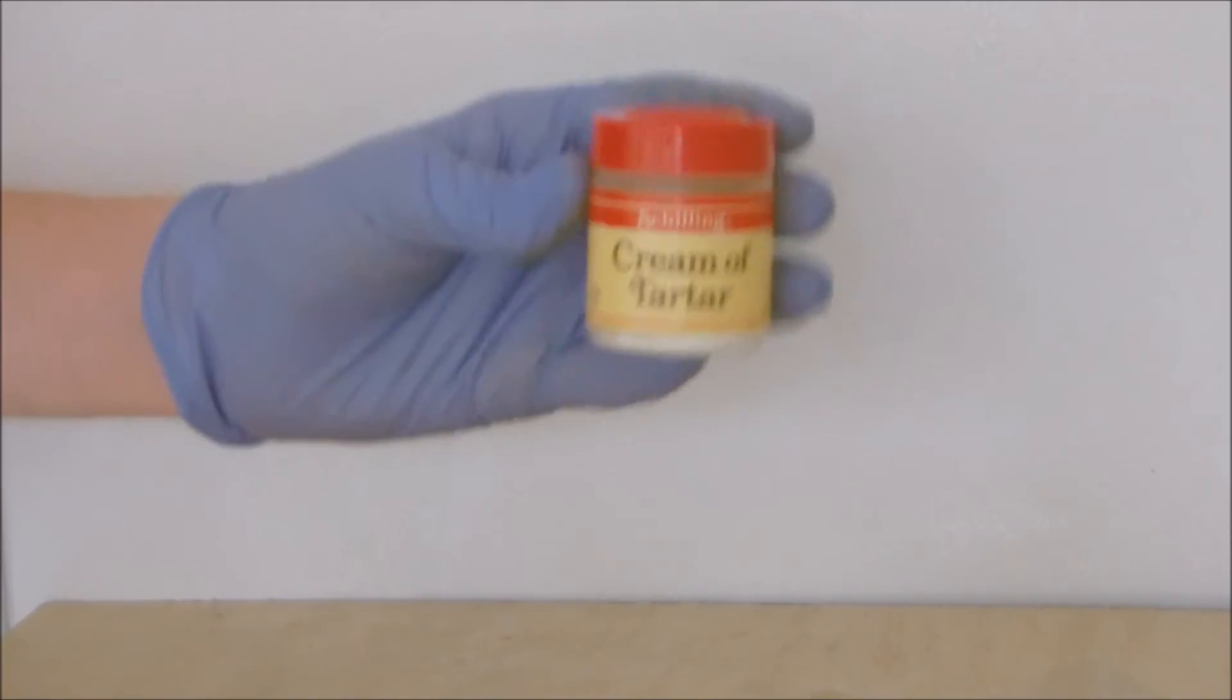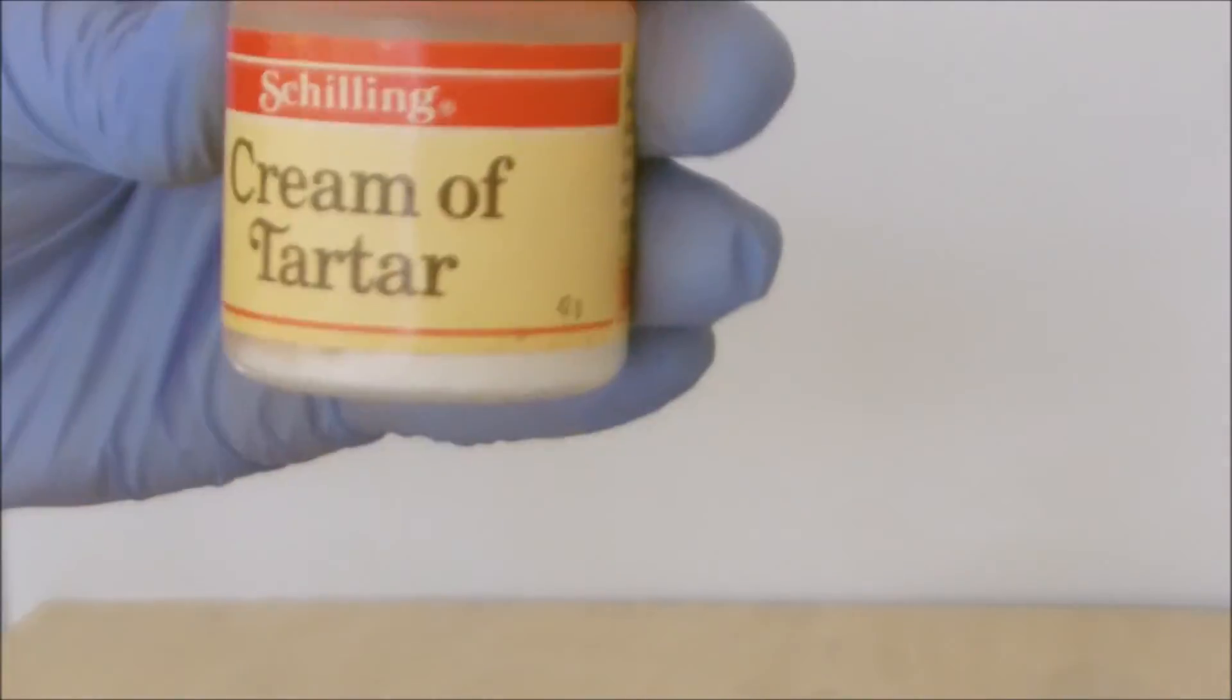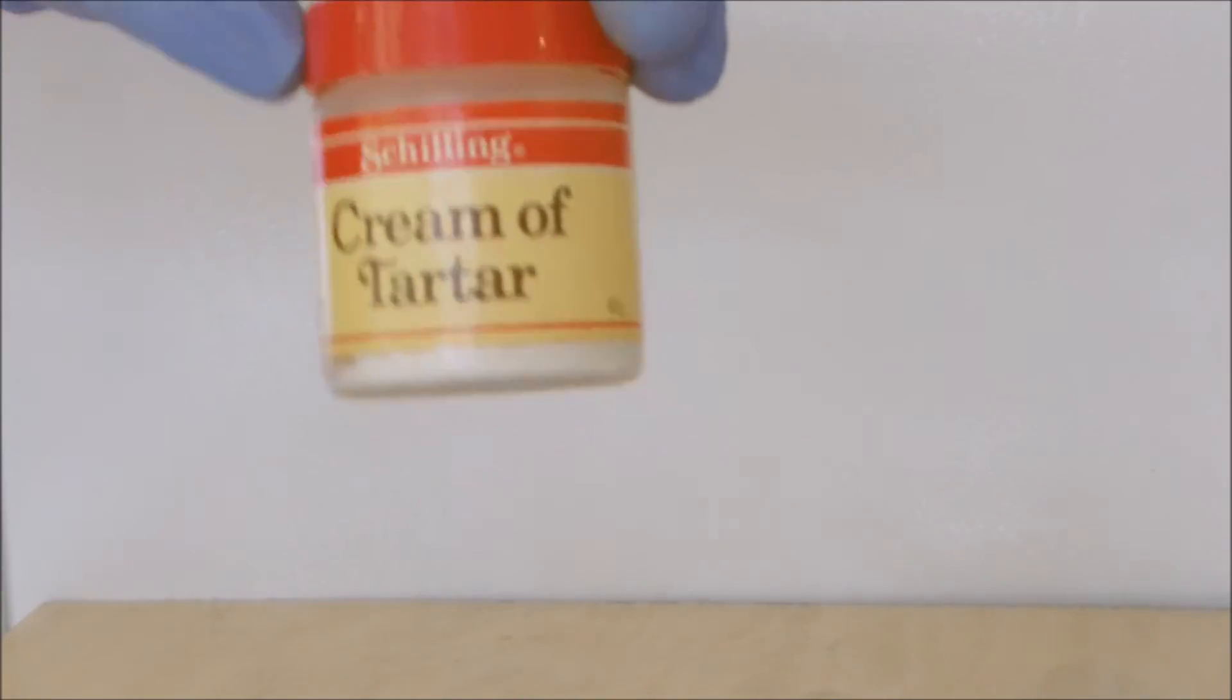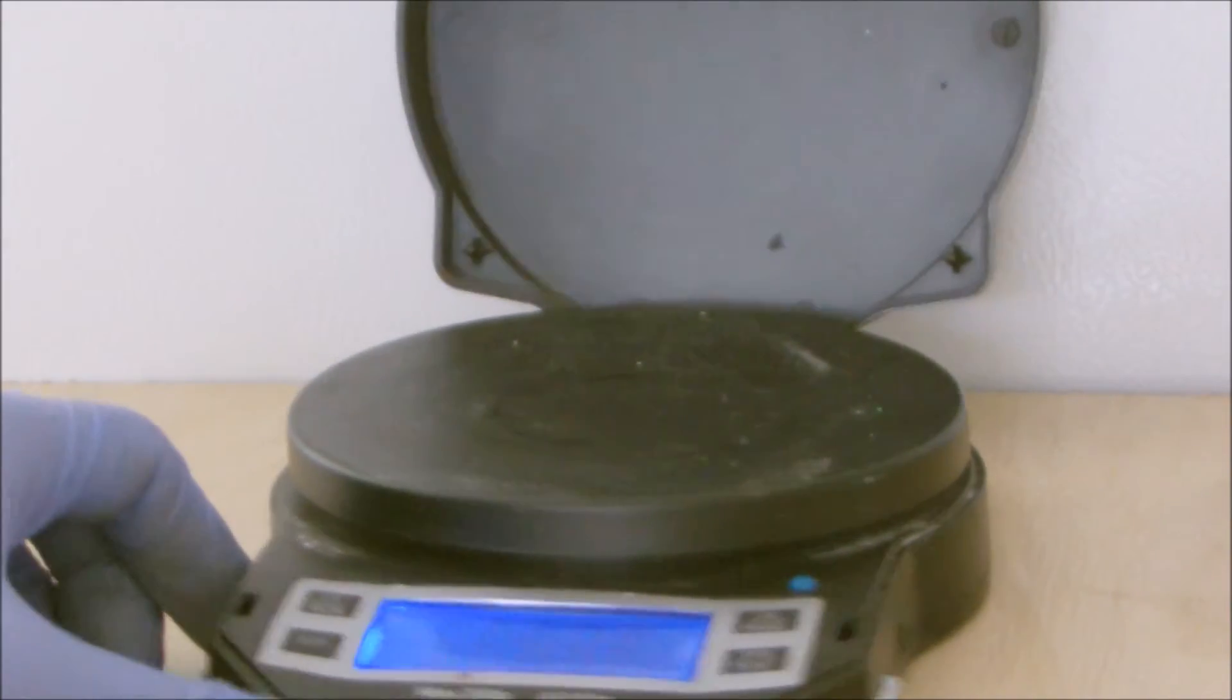As you can imagine, for the source of tartaric acid, I'm using cream of tartar, an over-the-counter source. Now let's measure it out.